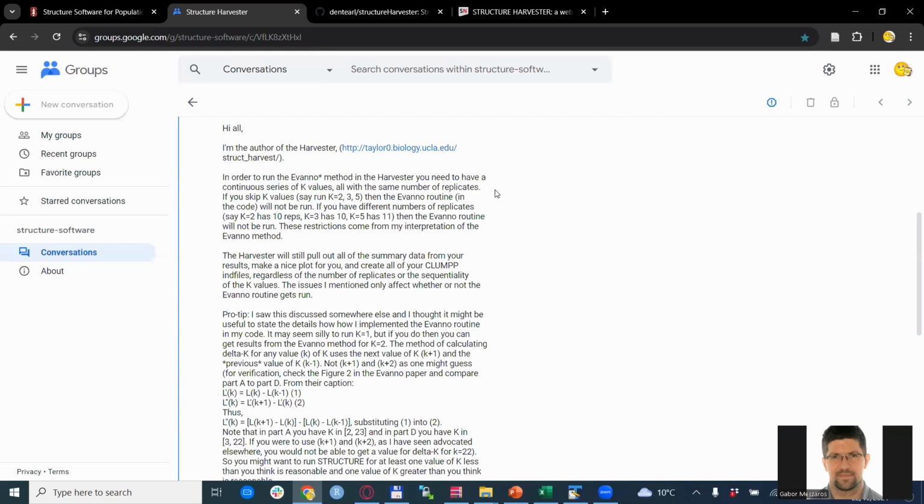This is very important because in order to do this, you need to run the structure accordingly. So we will do so and do a kind of sample structure run also in this video. I will show you how to do it the most efficient way. But anyway, this is the main thing that you need to keep in mind, that you need to do replicates, and you need to do the same number of replicates each time for each k-value. Again, the author underlines here that if you skip k-values, or if you do different numbers of replicates, this script will not run because of how the Evanno method is interpreted in the script that we are going to use.